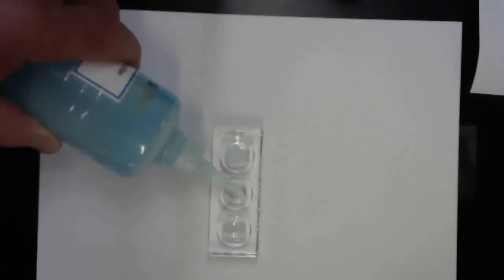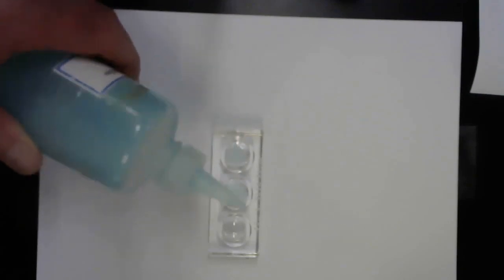All right, our fourth reaction is the combination of copper sulfate and barium nitrate. So I'm going to put the copper sulfate in first. And again, I'm putting it in 2 wells so you can see what the copper sulfate looks like. This is copper 2 sulfate. There are 2 forms of copper sulfate, copper 1 and copper 2. This is copper 2 sulfate.